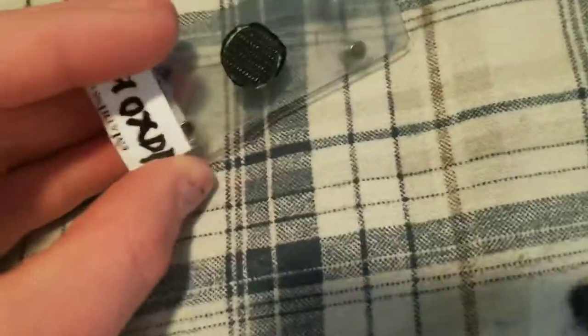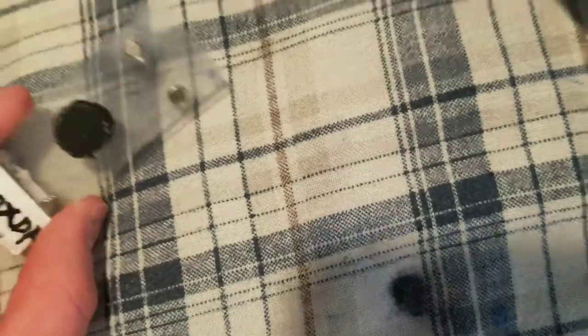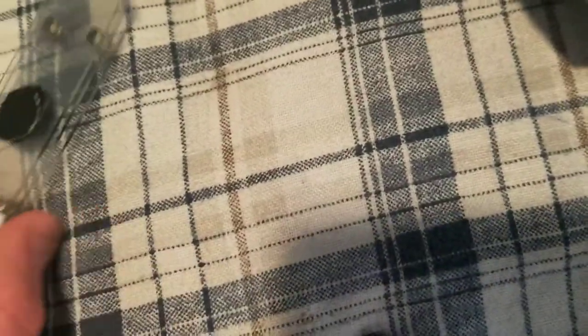I tested out prototypes with all different magnifications, and I found the right size for the 4x, the 10x, and the 40x lenses on my microscope.